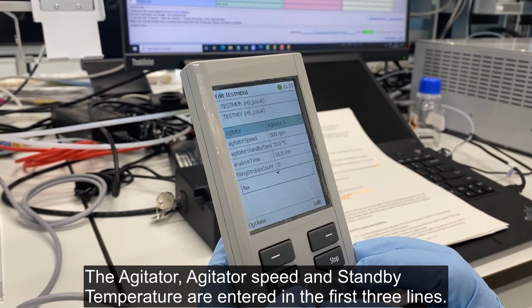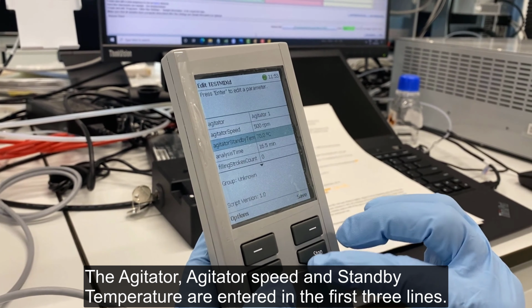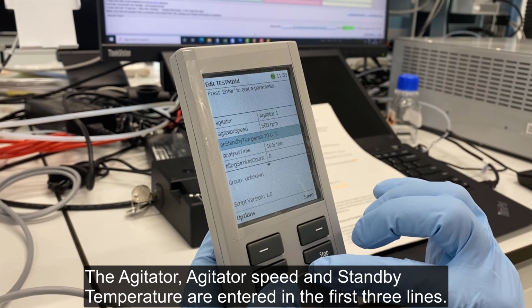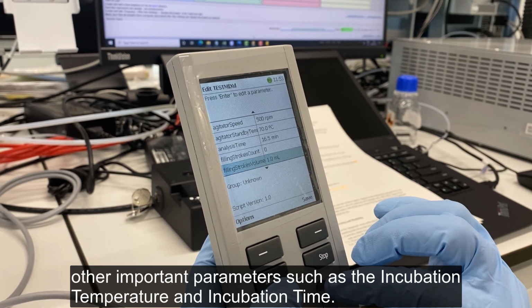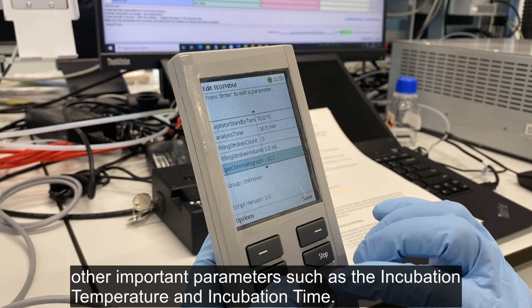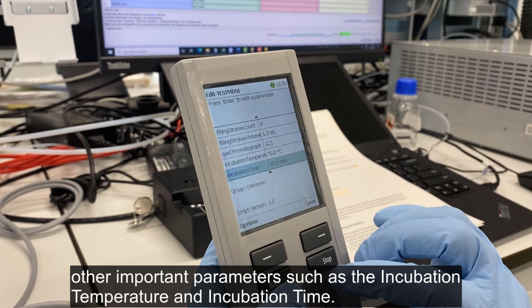The agitator speed and standby temperature are entered in the first 3 lines. The analysis time is entered in the 4th line. Upon scrolling down, we will have access to other important parameters such as the incubation temperature and incubation time.